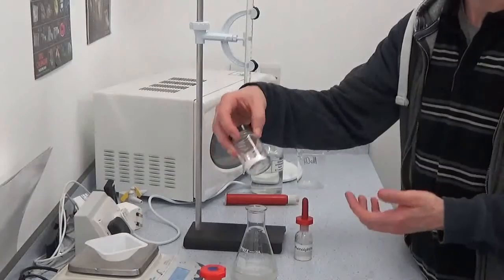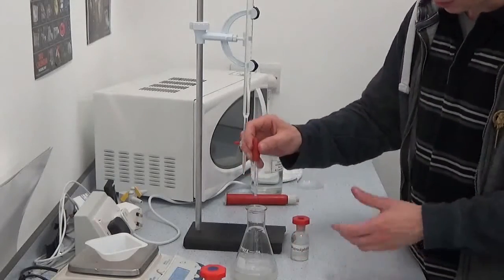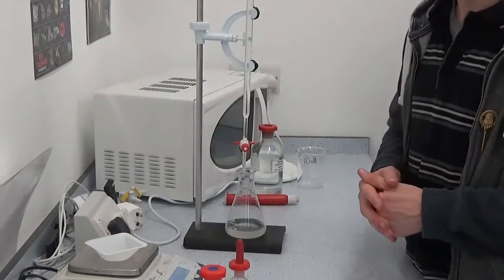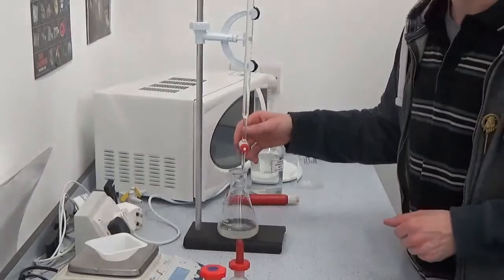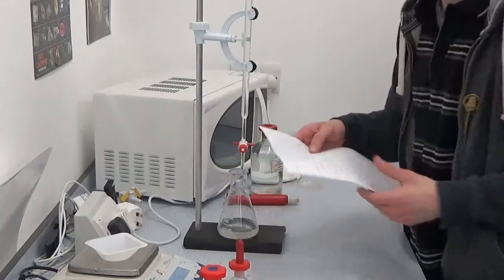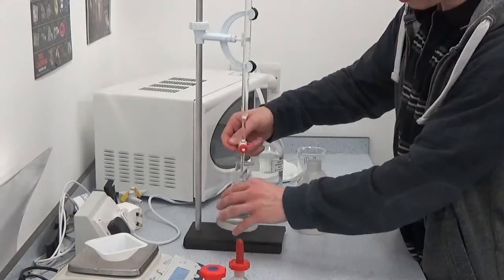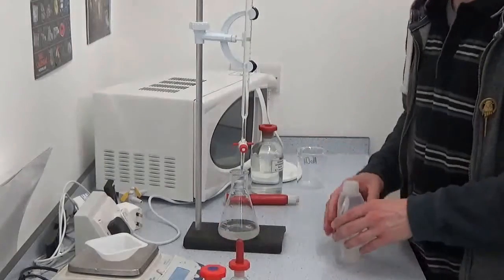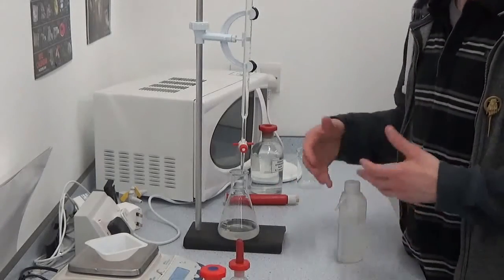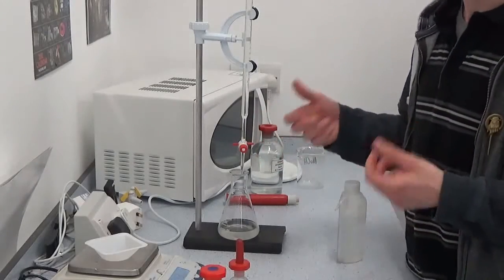What's reacted has reacted with the calcium carbonate that was in the mixture. Standard titration procedures: add a bit of indicator — two drops roughly — colourless because it's phenolphthalein in acidic conditions. I would now add the sodium hydroxide until I get a pink solution. You can use a white tile underneath to help you see the pink as it appears. If you pour the sodium hydroxide onto the side of the flask, squirt some water so it fully goes down and reacts. Repeat the titrations until you end up with concordant results — about 0.1 cubic centimetres of each other.